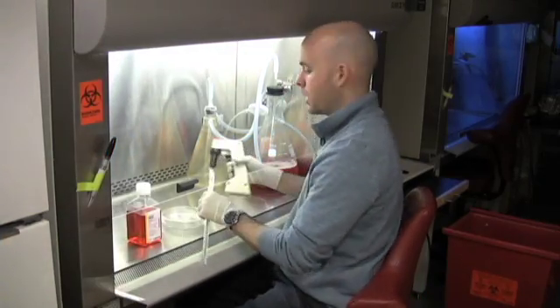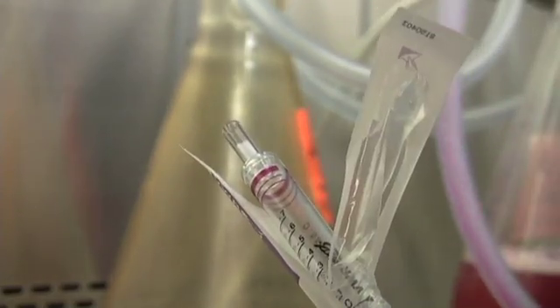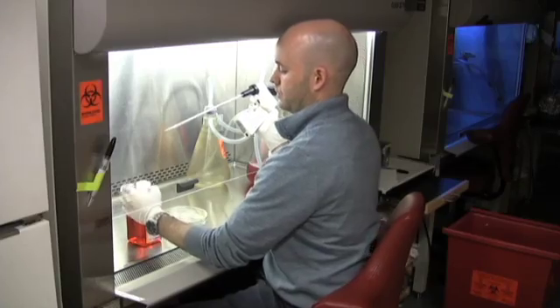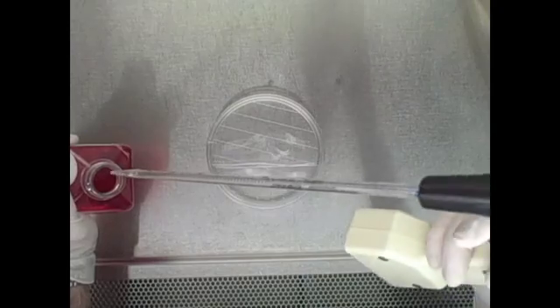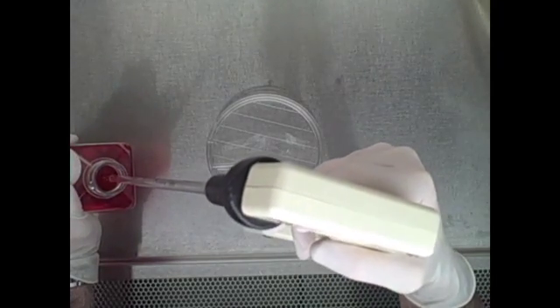Anytime you go into a bottle you want to tilt it so that your pipet hand is not over the mouth of the bottle.